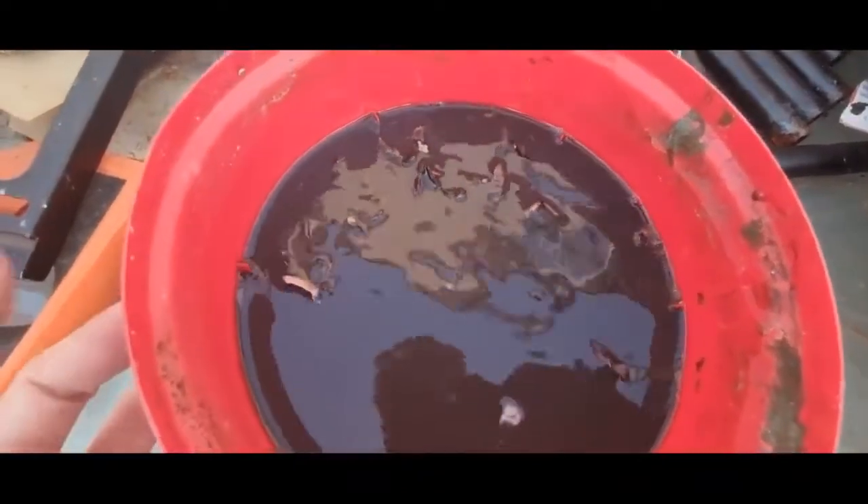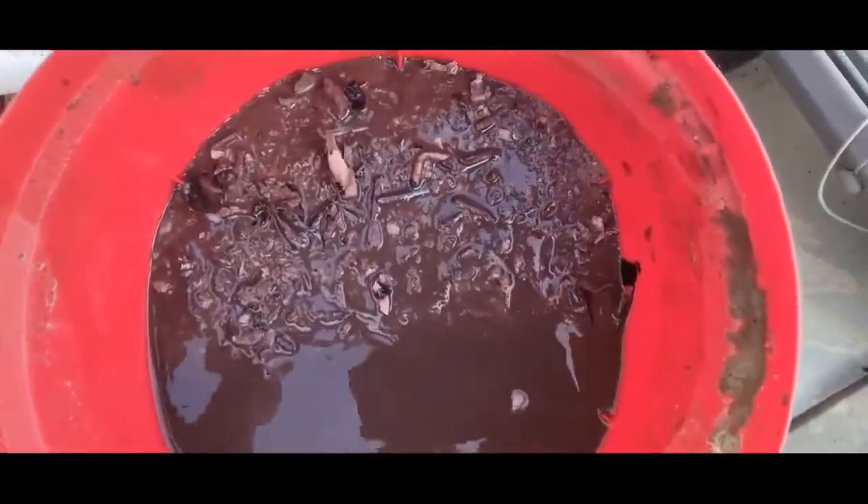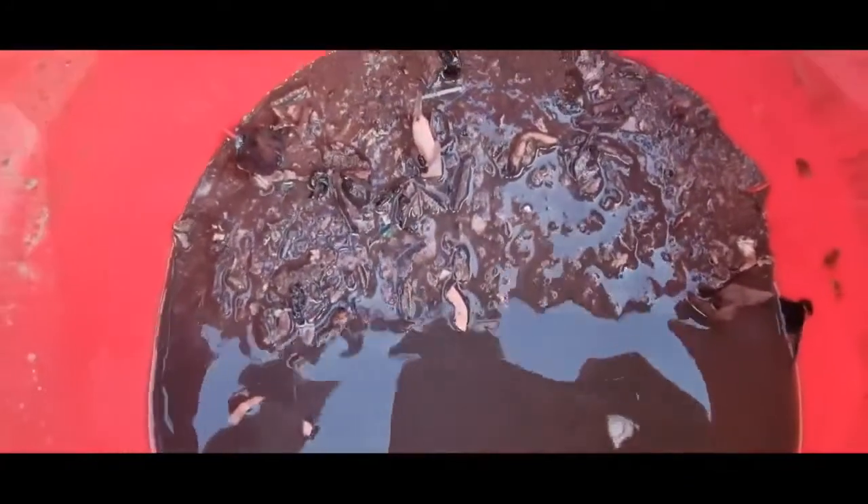It's been boiling in the UK so I'm just letting it all dry out in the sun. See there's a bunch of copper — they don't look very clean but once it's dry it'll be a lot nicer looking.